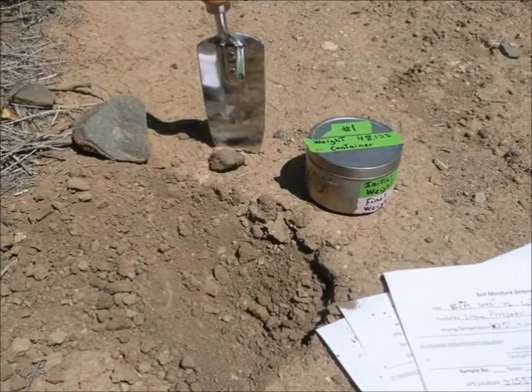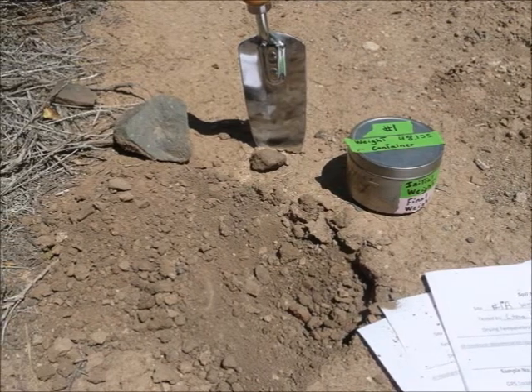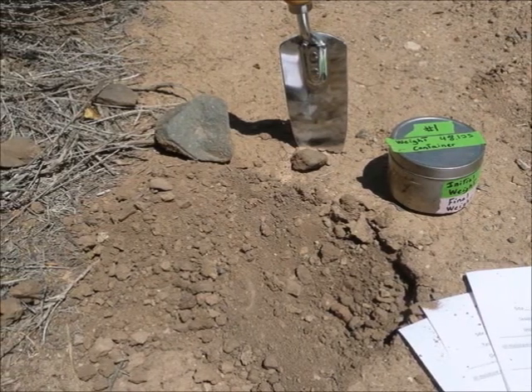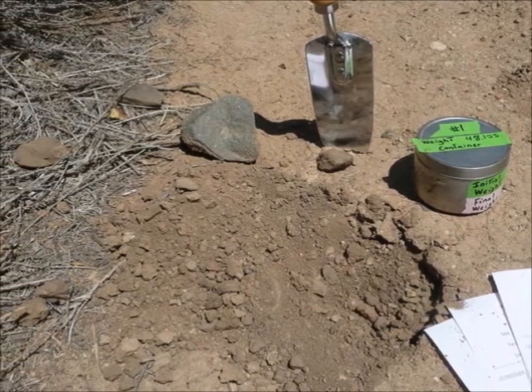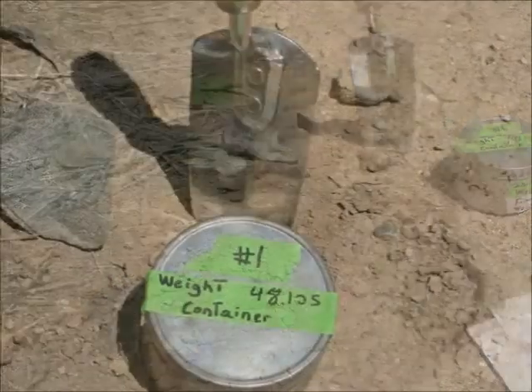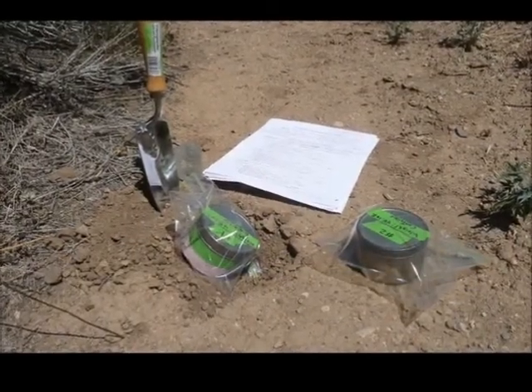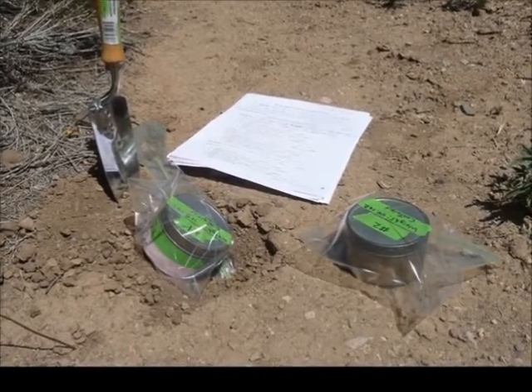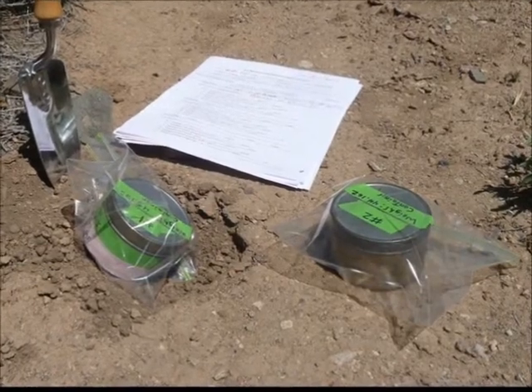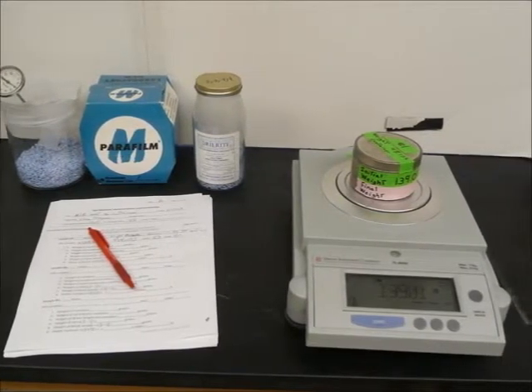Use a clean trowel to remove approximately 100 grams of soil at the pre-established sampling depth. Remove and replace any part of the 100-gram sample if it is unrepresentative of the soil matrix in the area. In this sample, the rock to the left of the trowel is obviously non-representative of the soil at this site and could greatly affect the final soil moisture percentage. Immediately close the lid to the container and return to the laboratory for the final analysis. If the soil containers are not completely airtight, quickly place the sample in an airtight container such as a Ziploc bag to prevent soil moisture loss. Samples should be weighed as soon as possible after the site visit to limit any moisture loss.